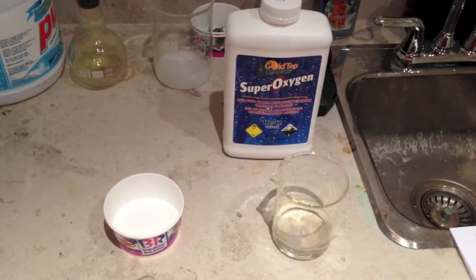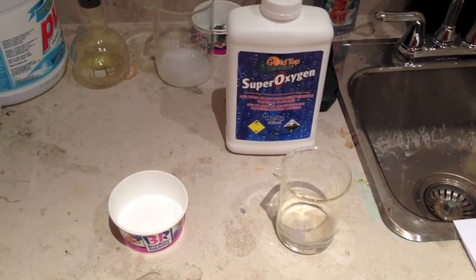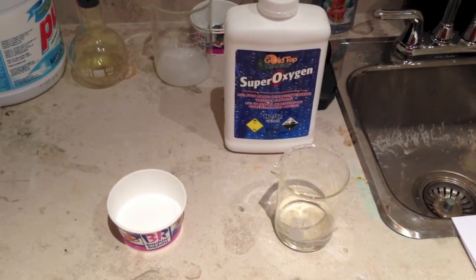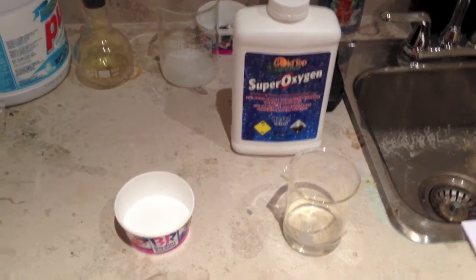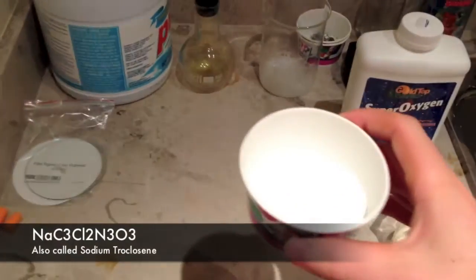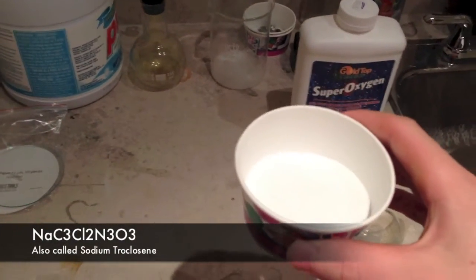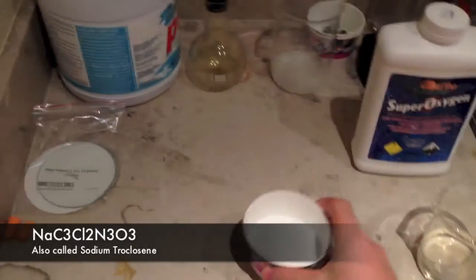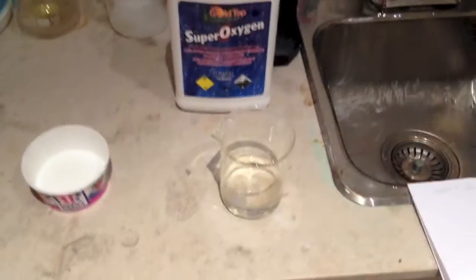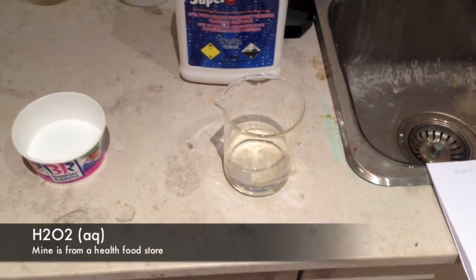Okay, so here we're going to see the evolution of singlet oxygen upon the addition of sodium dichloroisocyanurate, which is available as a pool chemical, into a solution of 35% hydrogen peroxide.